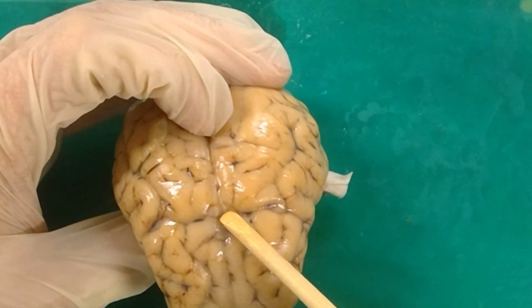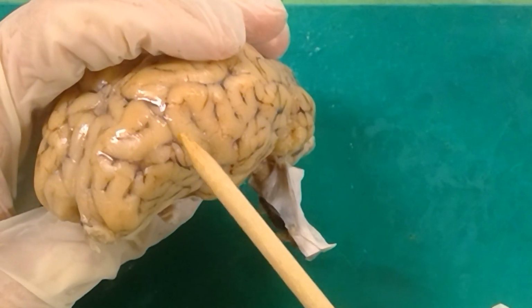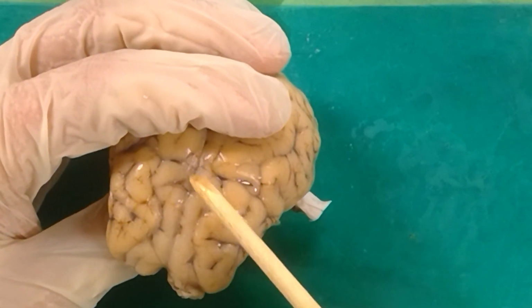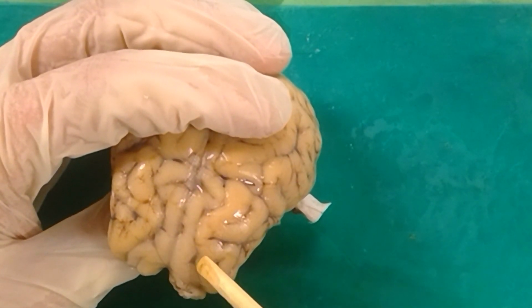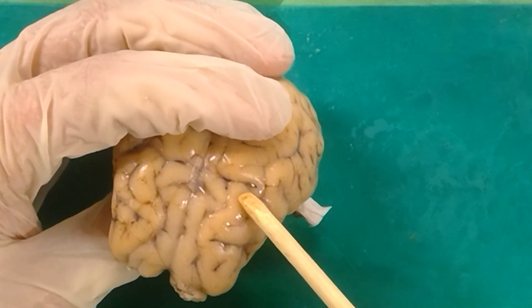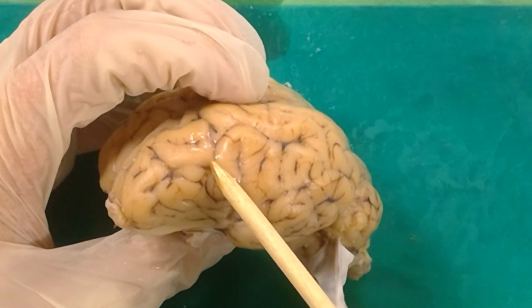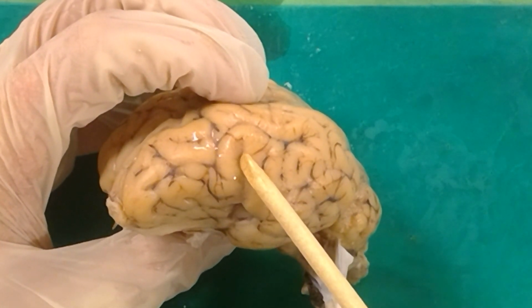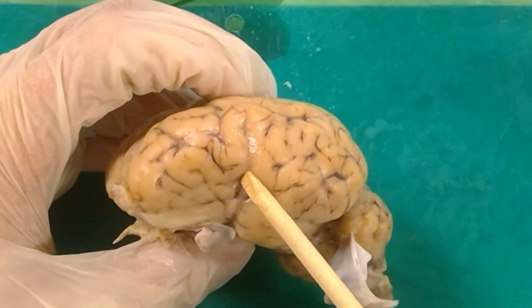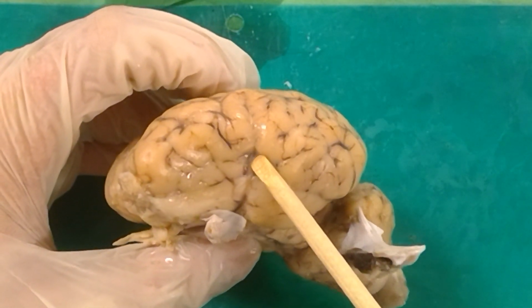So the cruciate fissure runs along here till it stops, about right there. Cruciate fissure running along those top parts. Superior frontal sulcus goes up until it hits the cruciate fissure. Cruciate fissure runs along this side until about here it stops. Now if we jump over this gyrus to the next sulcus we see here, this is known as the Sylvian sulcus. Sylvian sulcus runs right along the side here through this little dimple in the brain.